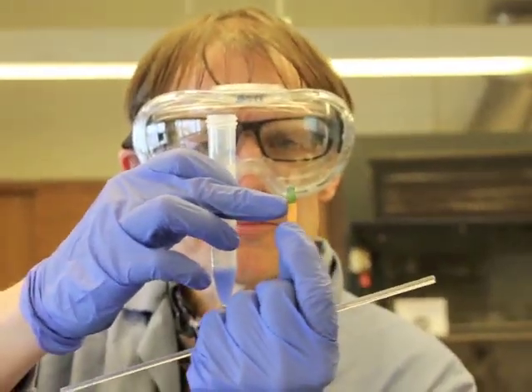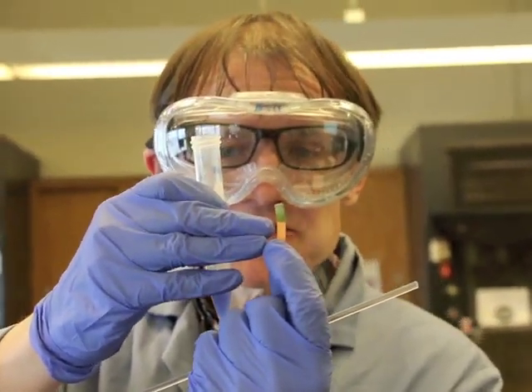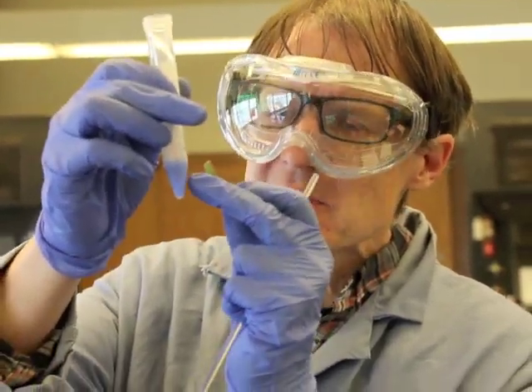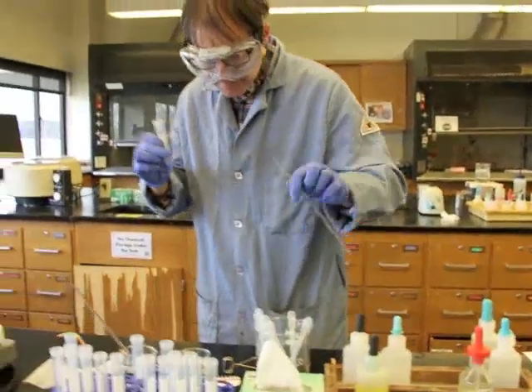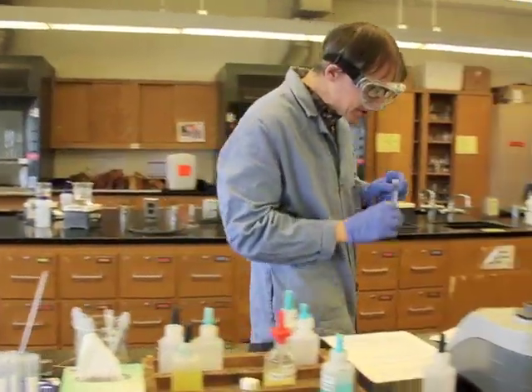The dark green litmus paper, or pH paper more technically, indicates that this is basic, which means that this solution that we put the drop on must be basic as well. That's what we expect it to be. Okay? So now what I'm going to do is just rinse this here a little bit. And now we're going to come up to the next step.